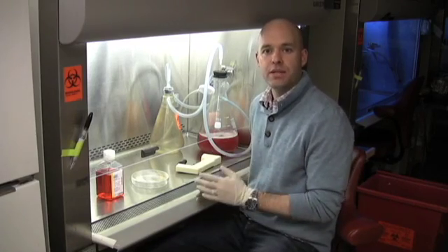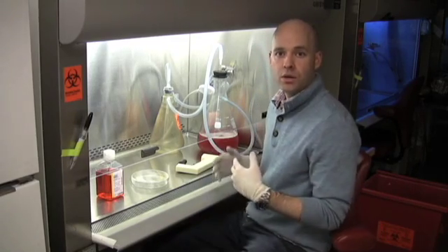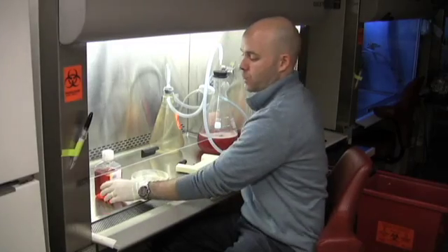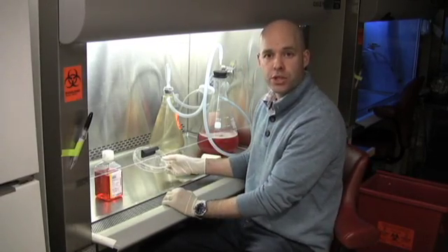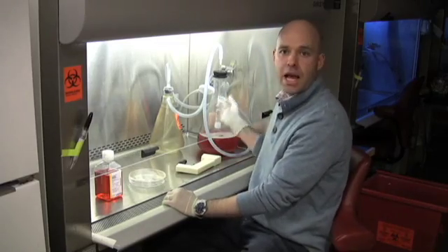Today we're going to discuss three of the basic techniques you'll use when working in a hood. The first is working in bottles, taking out and adding media. The second is working in the tissue culture dish, and the third is aspirating media.